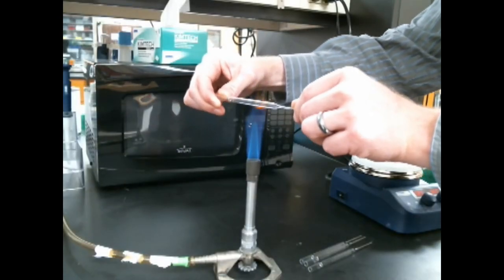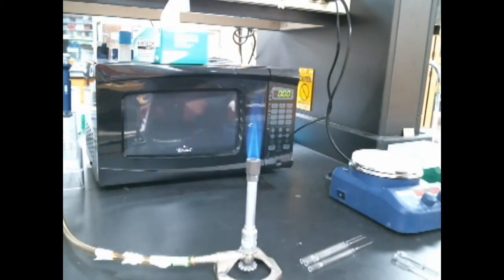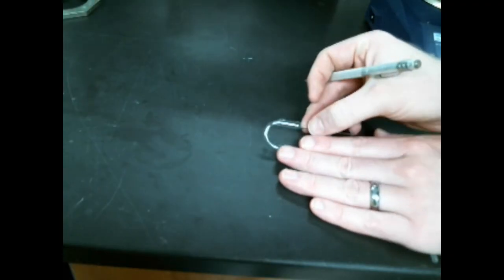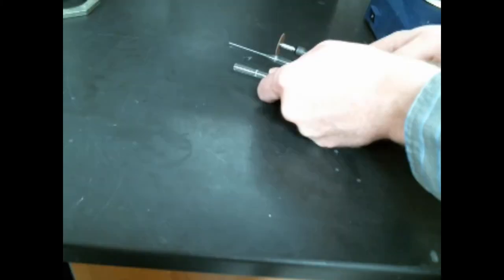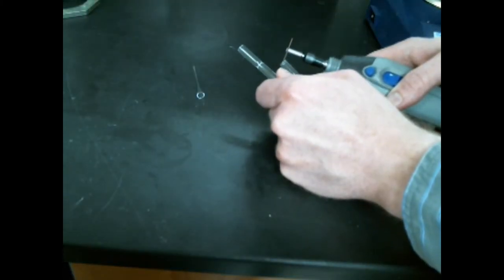First we're going to put on some goggles, then we're going to heat a piece of glass tubing until it starts to bend. Took me about five minutes but we got a nice U shape. Now I'm going to score that piece of glass with a diamond scribe and then cut it off with a dremel and then deburr it a little bit to make sure I don't cut myself.